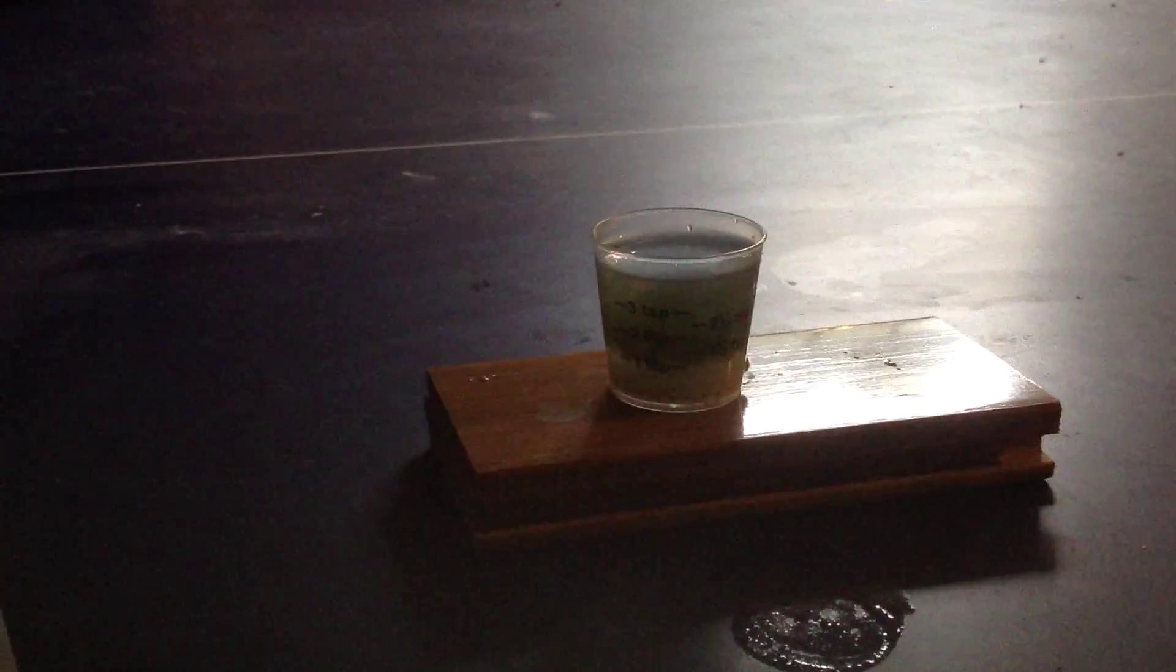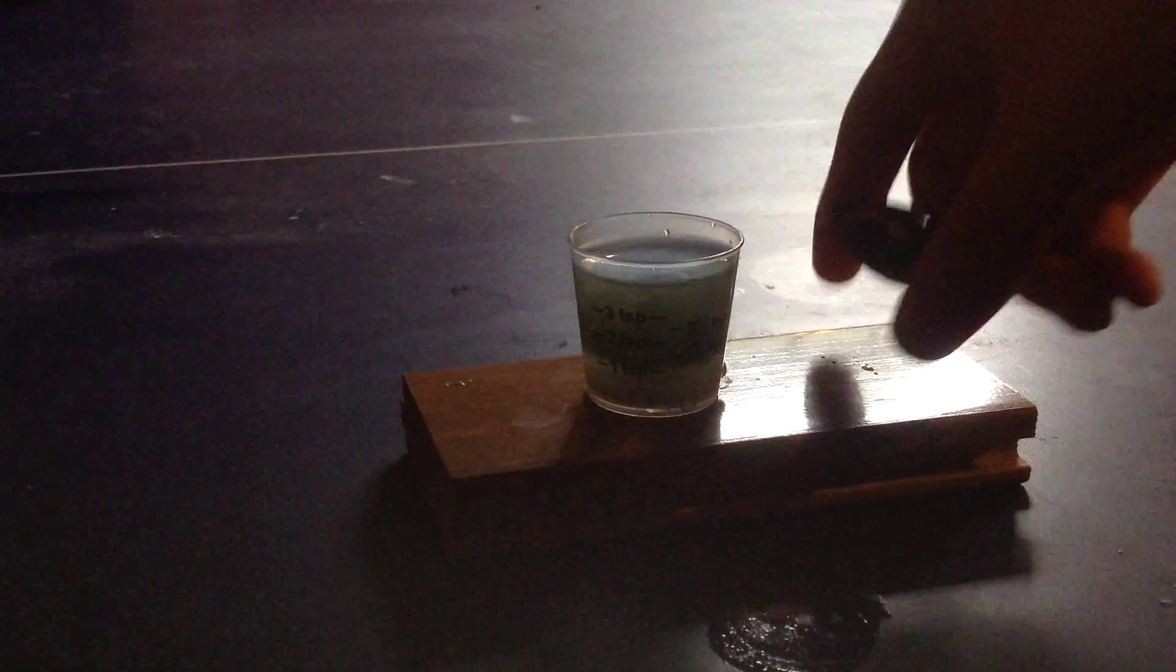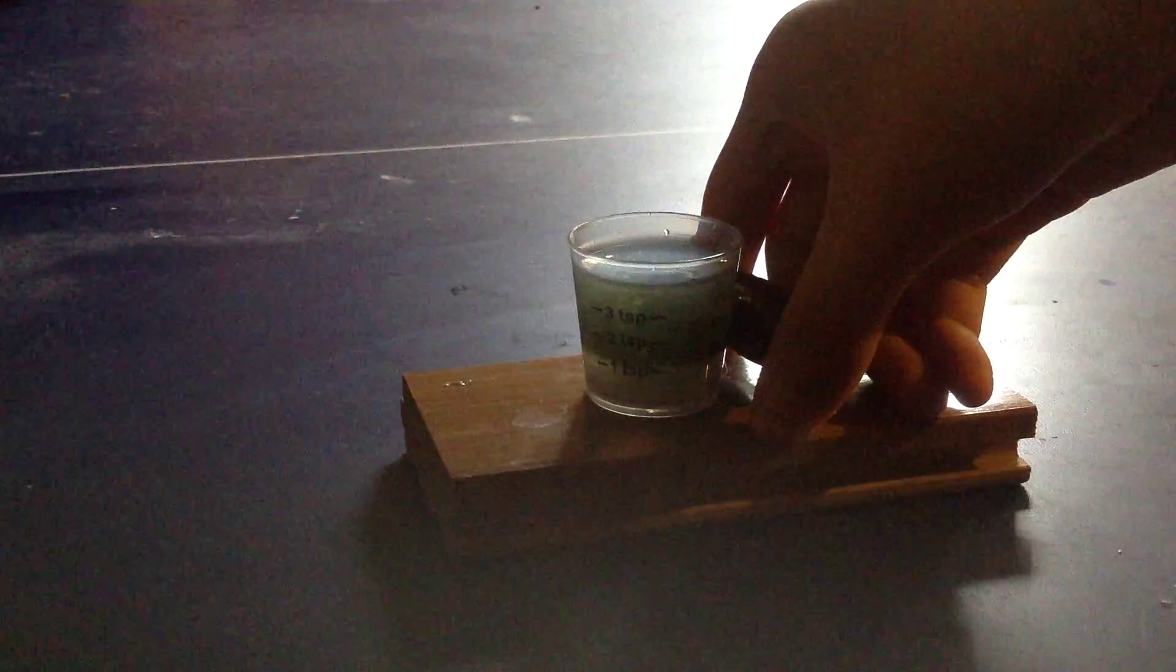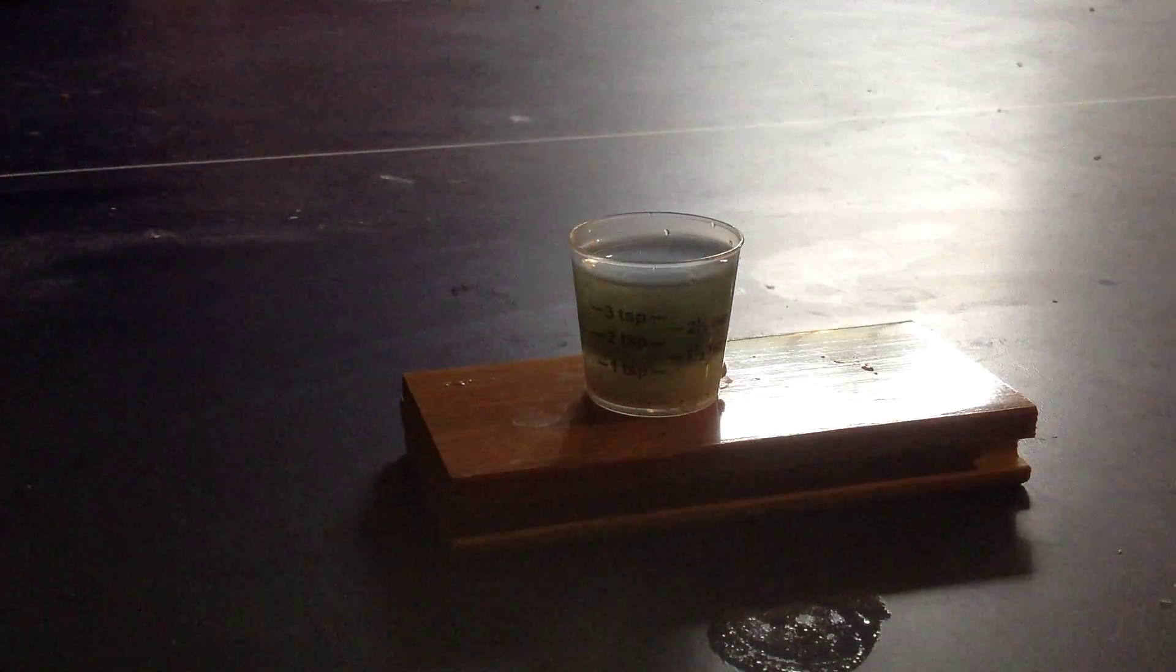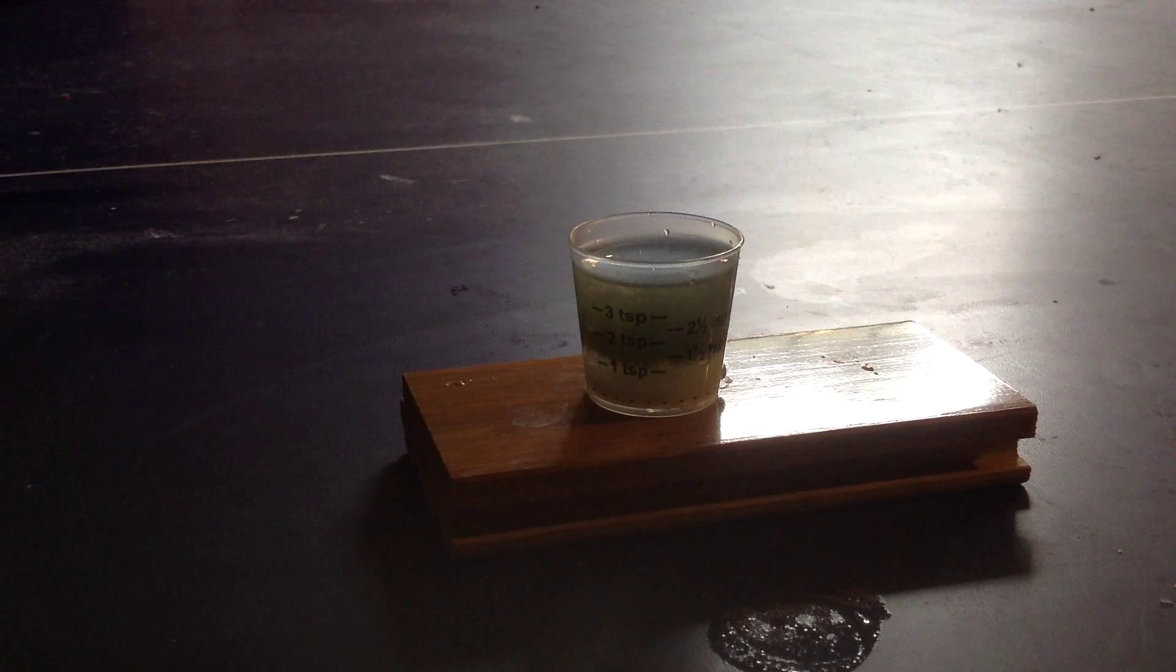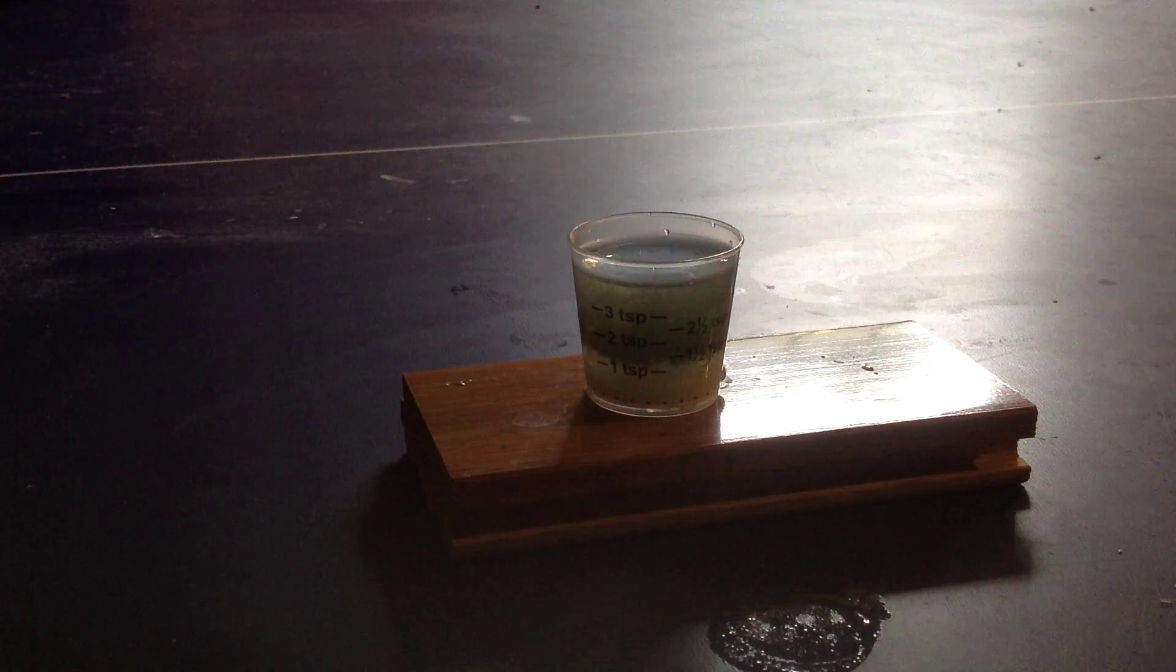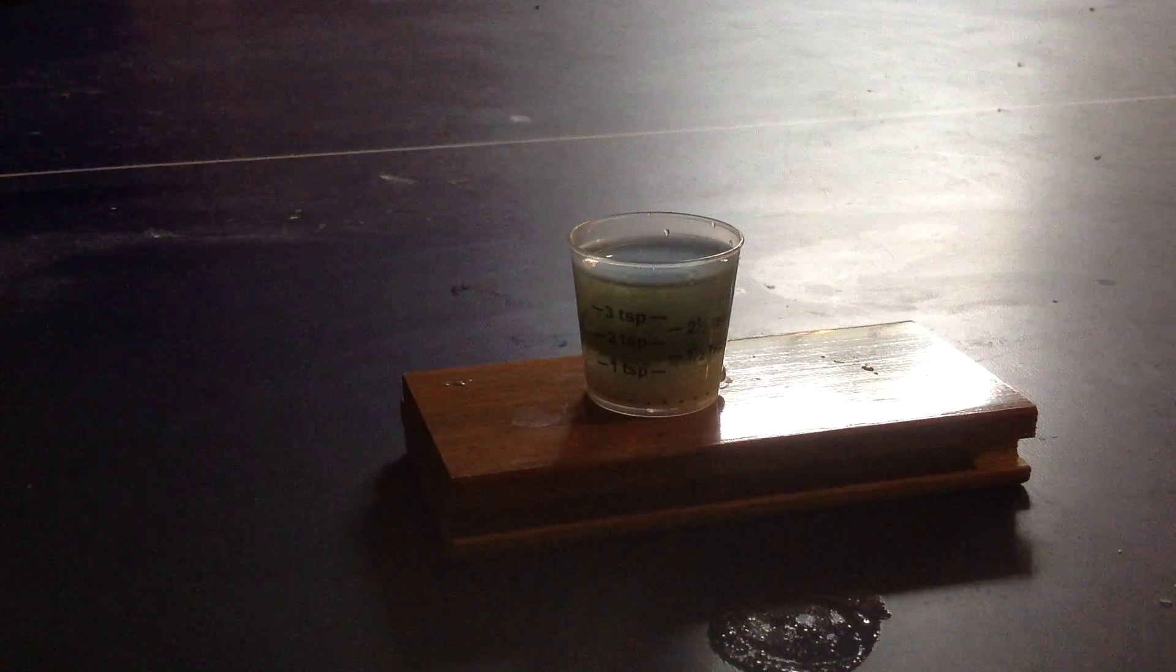So now that you've got your solution of iron 2 hydroxide I'm going to demonstrate how it's not magnetic. Nothing's happening. So the Schikorr process will be sped up by heat obviously. I'm not sure if it occurs at room temperature but the heat is really simple to make. You'll put it in bursts in the microwave and make sure you don't melt the container. The duration of time you should base it on your logic. For this size container I say four or five seconds maximum.